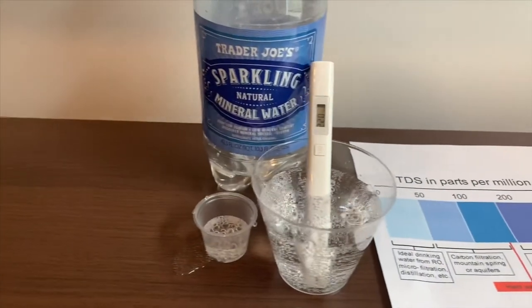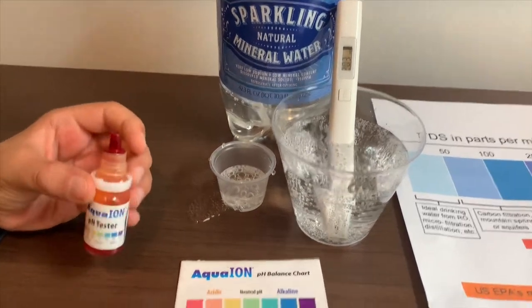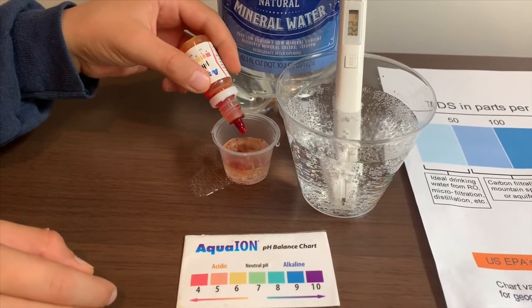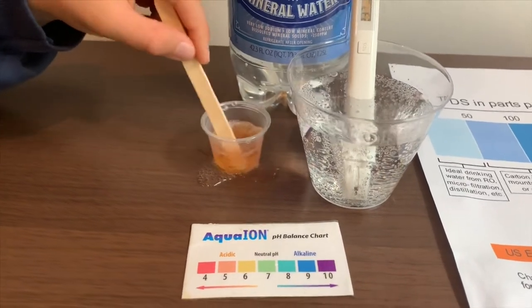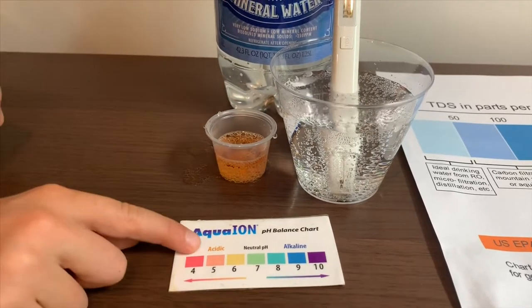Now let's test the pH level. If you want to buy this pH tester, check the link down below. I'm going to do two drops. Let's stir it a little for a better result. I'll give this a six — this is acidic.